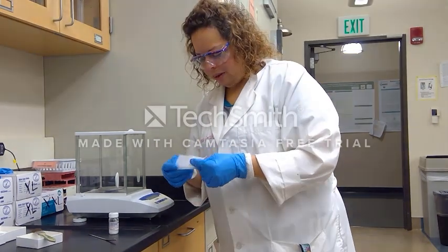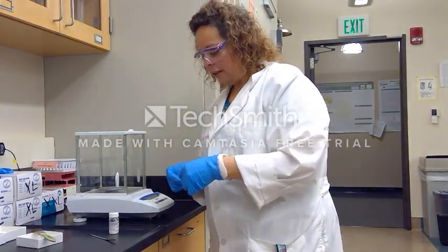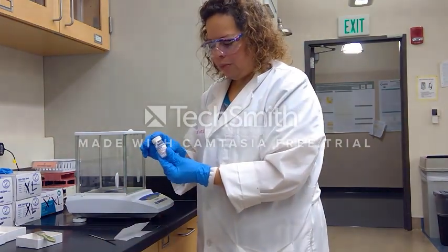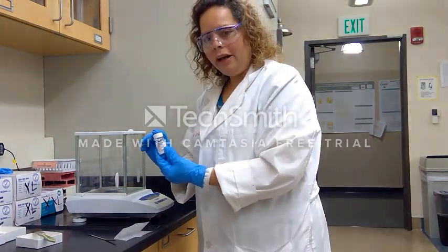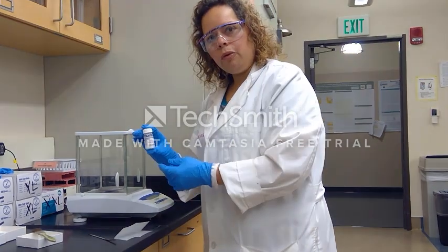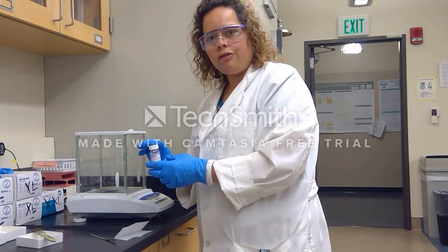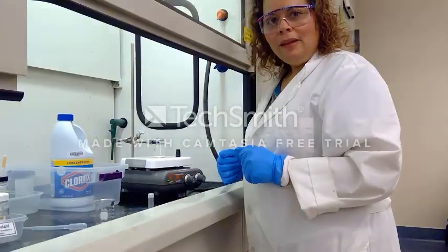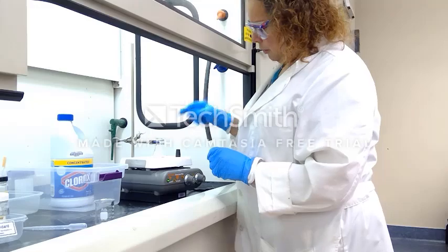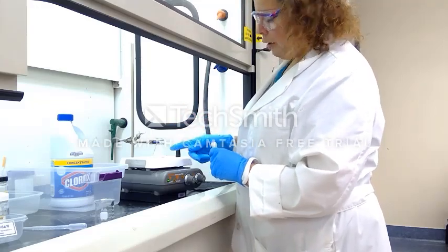The next item I am measuring out as a solid is our phase transfer catalyst, tetrabutyl ammonium hydrogen sulfate. For this we will be adding 40 milligrams, or 0.04 grams, of solid to our reaction mixture. In my 25 milliliter Erlenmeyer flask I now have my benzhydrol and the 40 milligrams of tetrabutyl ammonium hydrogen sulfate catalyst.